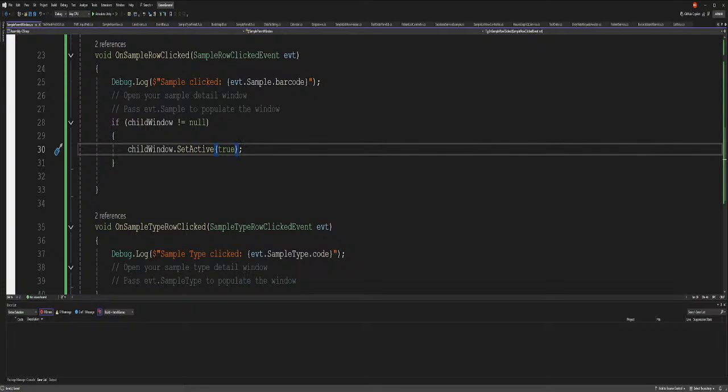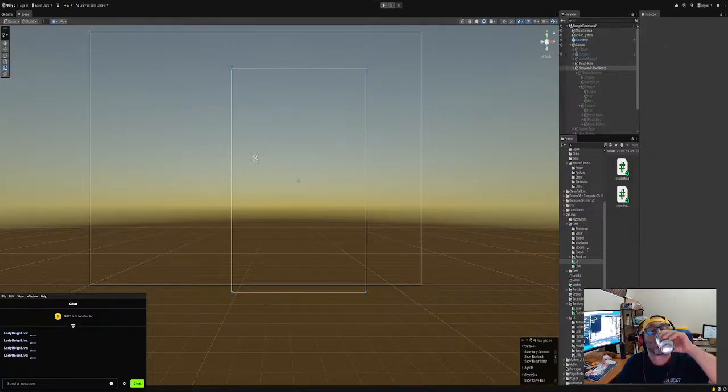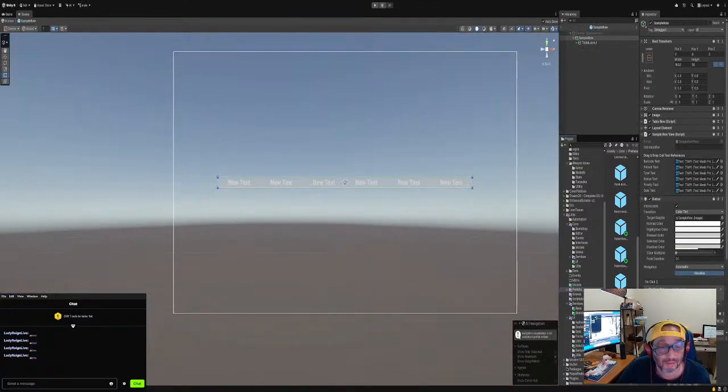All right, so then we go back. This is a pain in the ass. Now we go back and see my windows. Okay, my editor is working. Let's go back to the prefab. What was the prefab at? I gotta be more organized. No, I am organized. Okay, we are on the prefab.